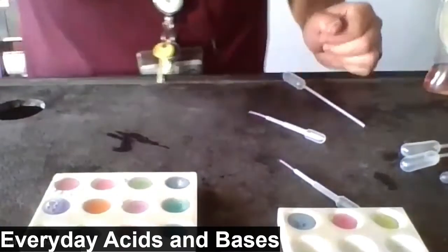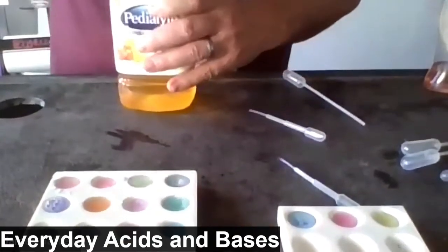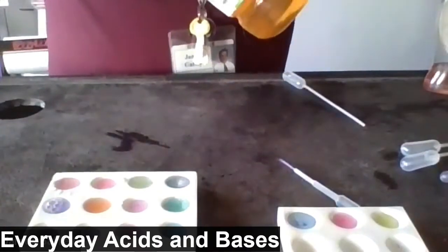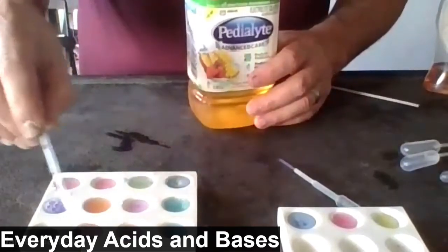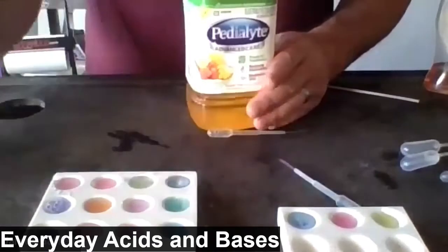All right, one last substance, Pedialyte. Pedialyte is a beverage like Gatorade. And kind of like the other drinks, we see a reddish color indicating an acid.